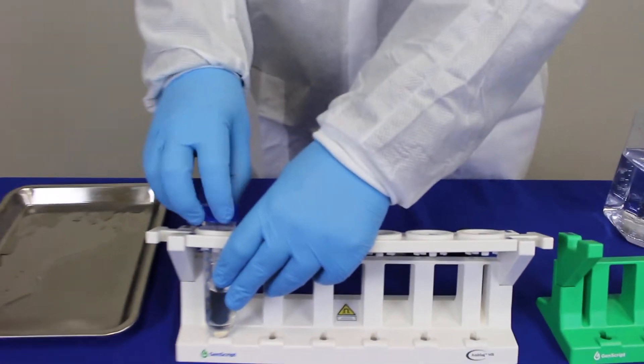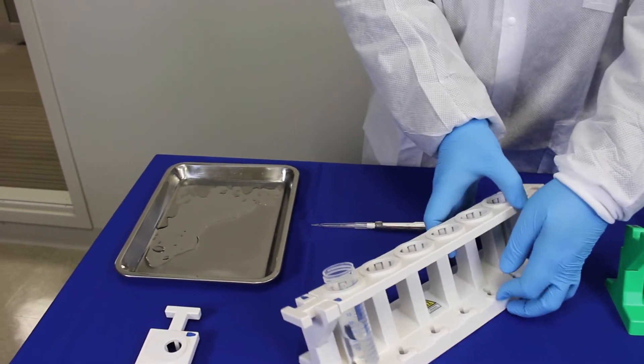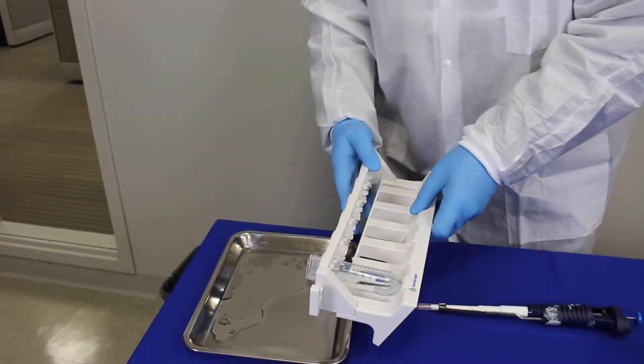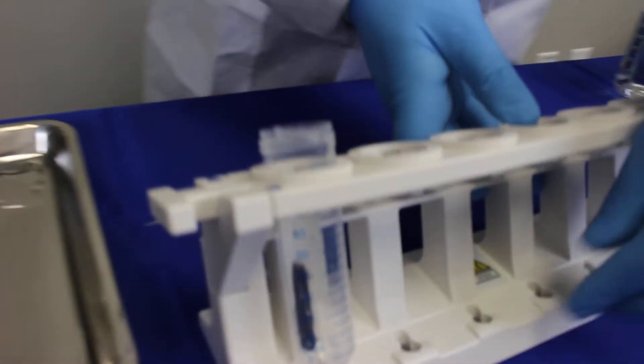Now you open this tube and just dump all the liquid into the tray. Please make sure to remove all the liquid from the tube.